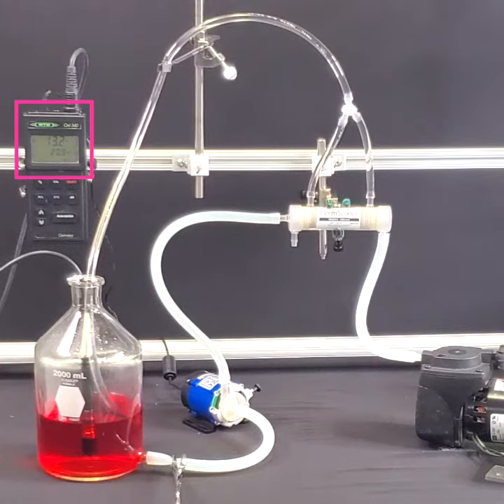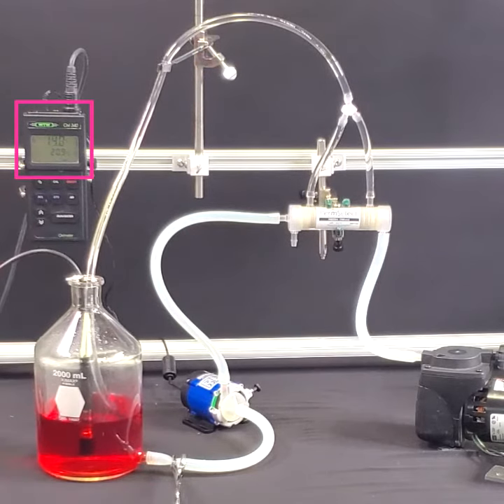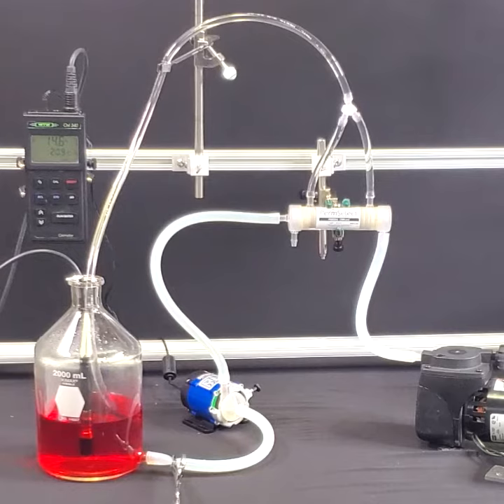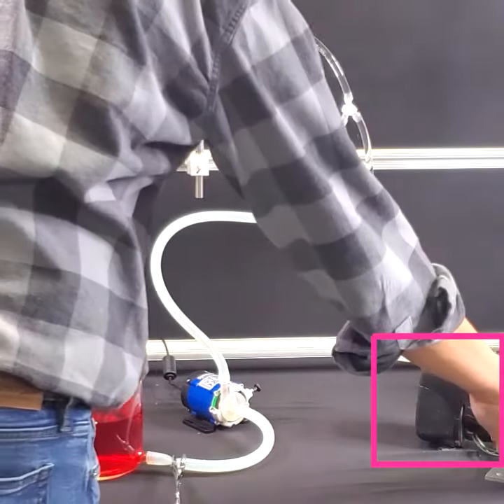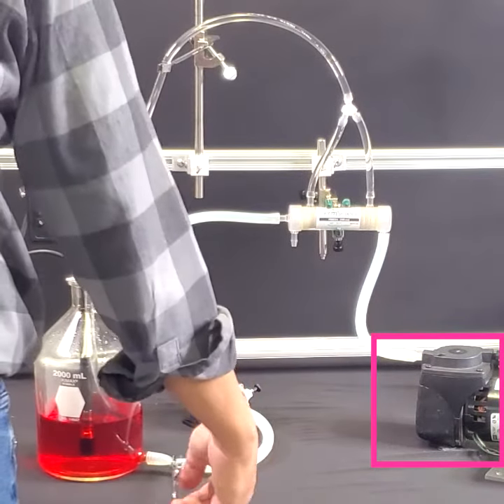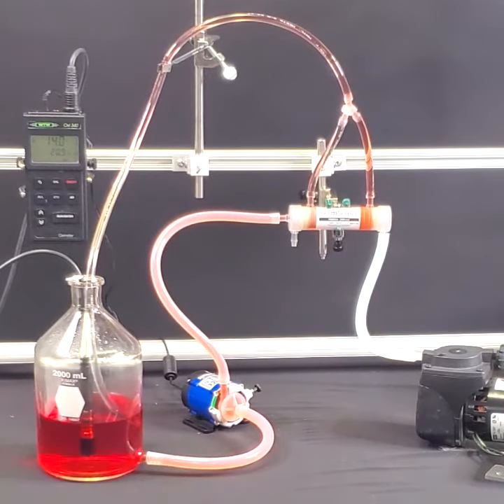Note the initial conditions are 1.3 milligrams per liter or 14.5 percent saturation. We initiate airflow to the gas exchanger by turning on the air pump and initiate water flow by releasing the clamp and turning on the centrifugal pump.